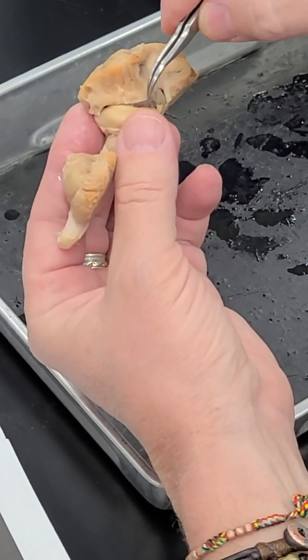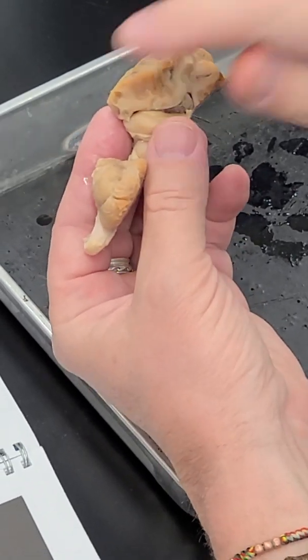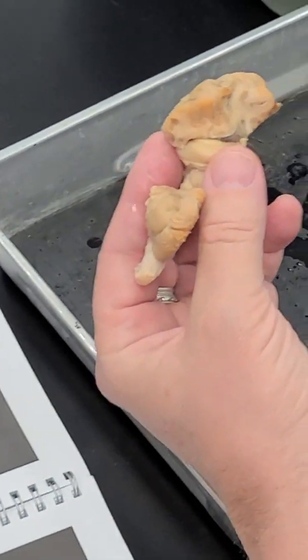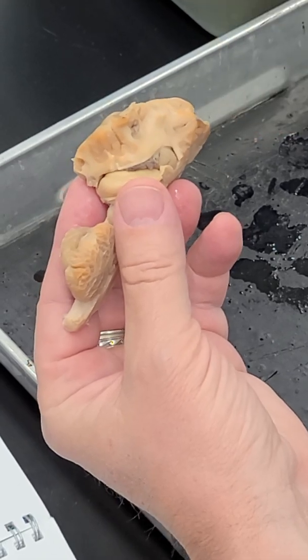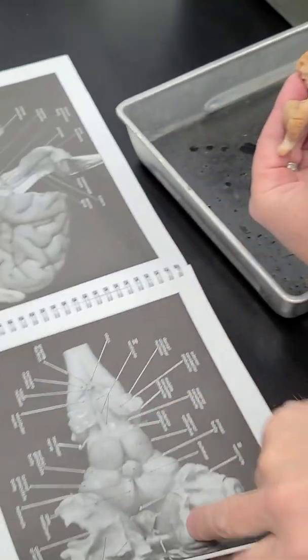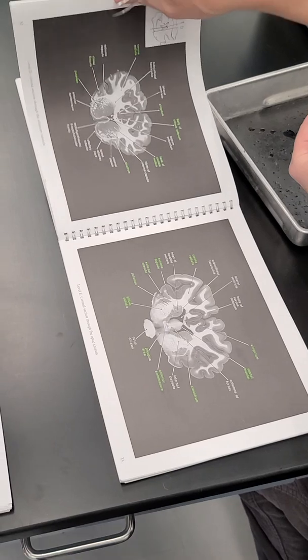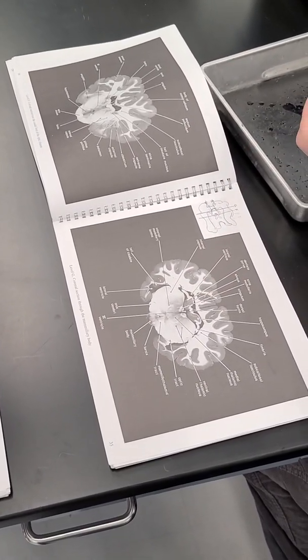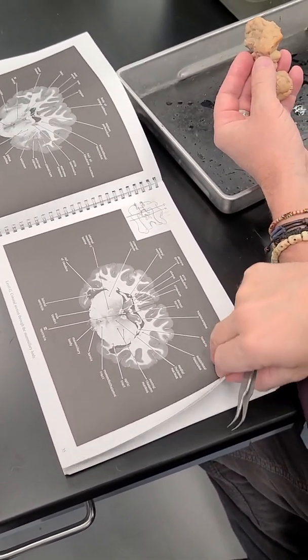And then remember, the lateral ventricles have this kind of C-shaped structure as the hemisphere grows toward caudally and then inferiorly. And the hippocampus and the basal nuclei and the ventricle all reflect that C shape, which can be confusing when you're looking at the coronal sections, because in some of them you'll see some structures both above and below the lateral ventricle, depending on where on that C shape they are. And the hippocampus is one of those that's kind of problematic.